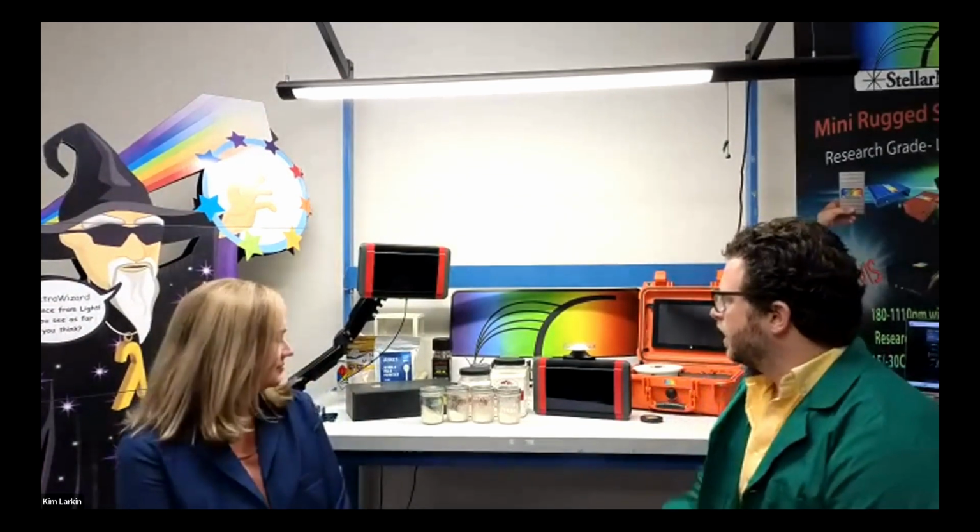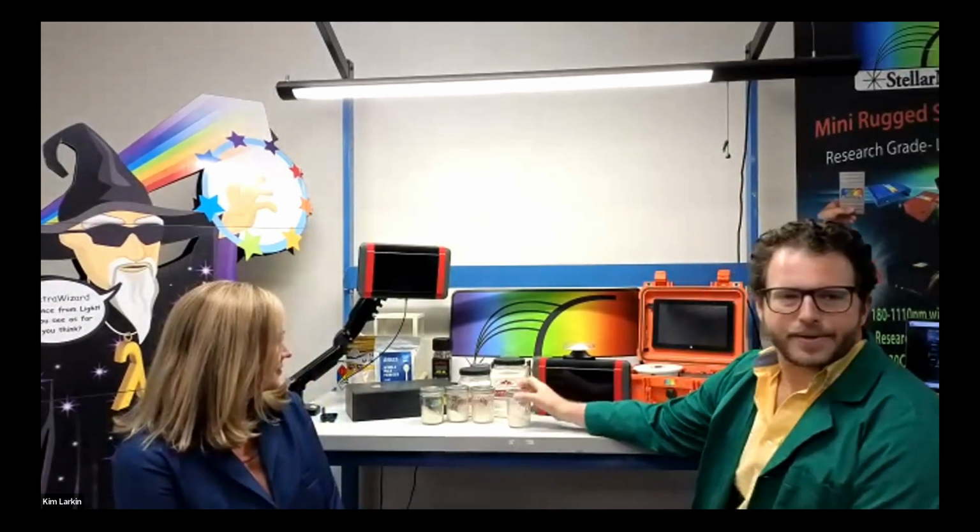We are going to show you our ChemWiz-ADK Dairy Analyzer. We have a demonstration of different milk powders, and we're going to measure a milk powder sample, and we're going to add it to our calibration model for milk powder.